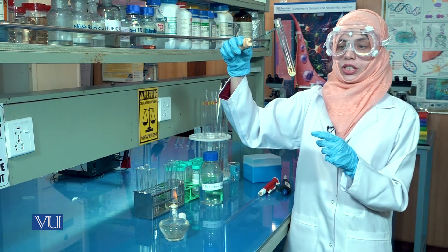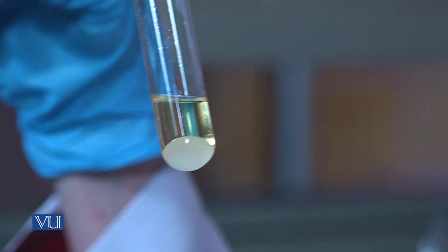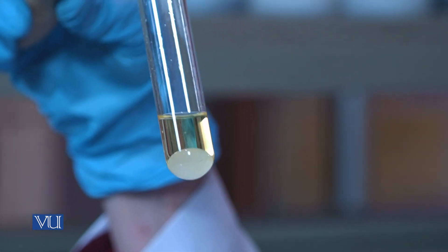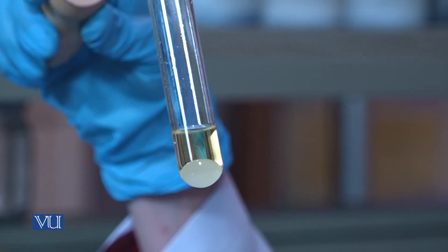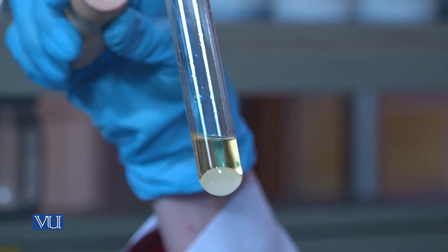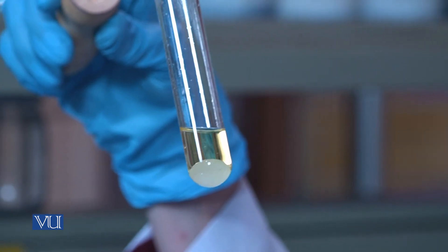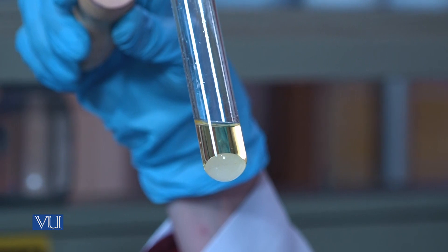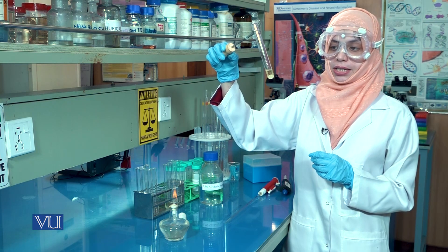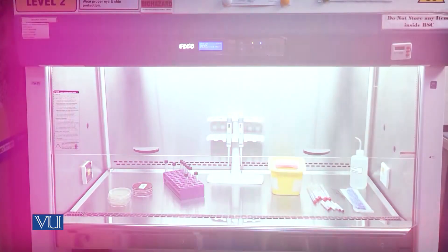After heating, you will observe that there are two distinct layers in the test tube. The denser layer contains soap, or the salt of the fatty acid formed as a result of this reaction, whereas the liquid layer contains glycerol and any leftover alkali. This test confirms that the sample contained a lipid. Thank you.